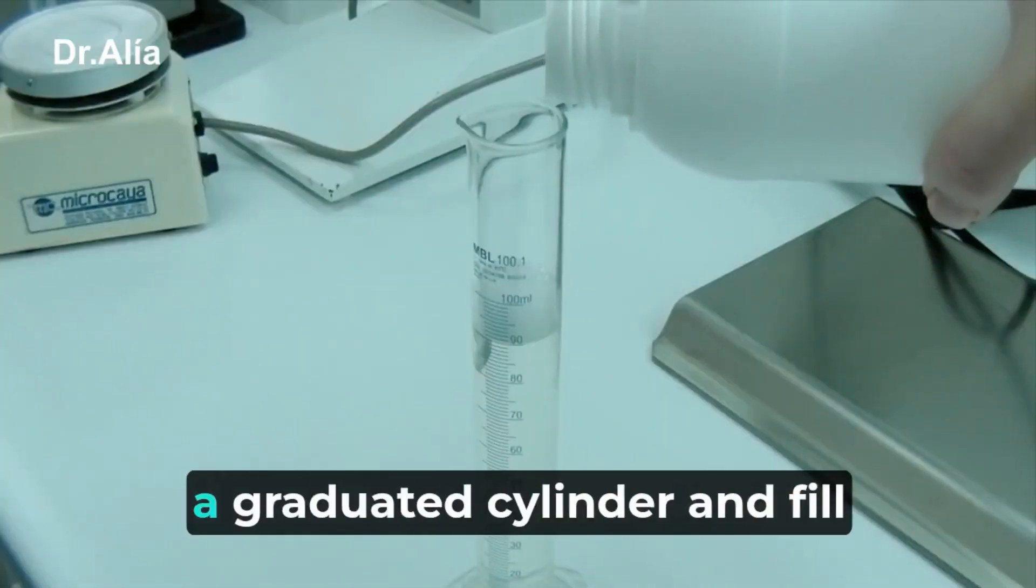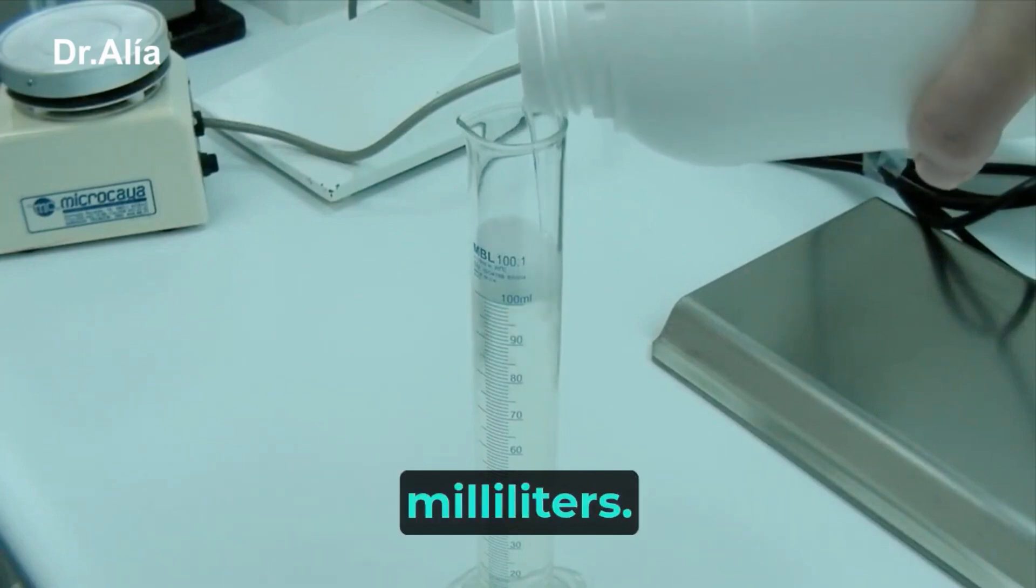Place the resulting solution in a graduated cylinder and fill with foam base up to the prescribed 100 milliliters.